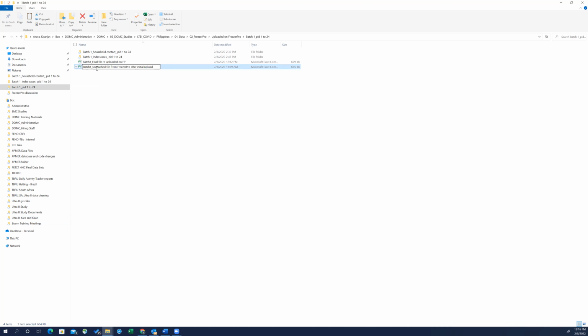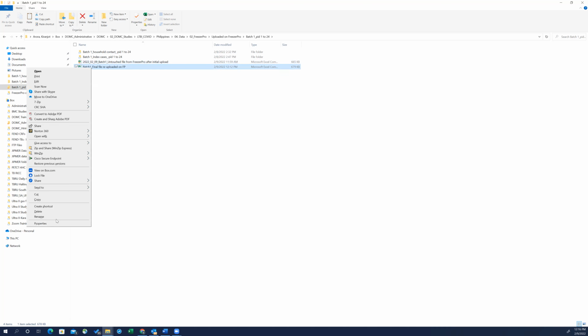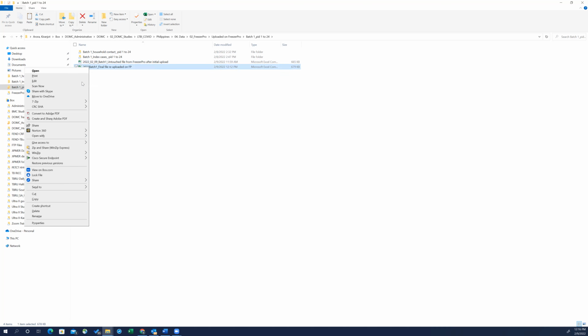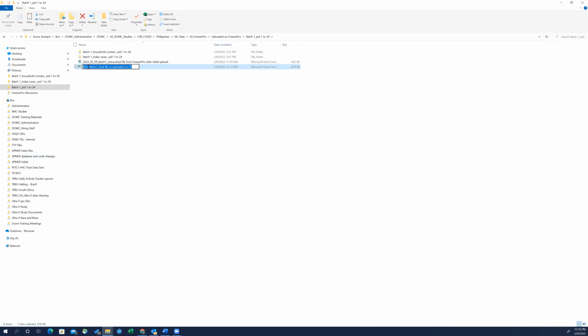Another thing that I would recommend is to also put a date over here. So this is 2022 0209, so that I remember which date I made what change, and you can also track it on the audit log. 2022 02, oops. 0209.